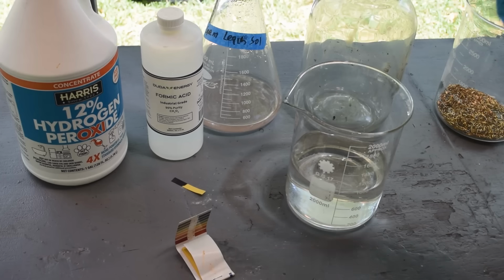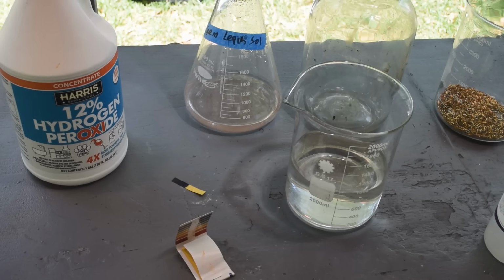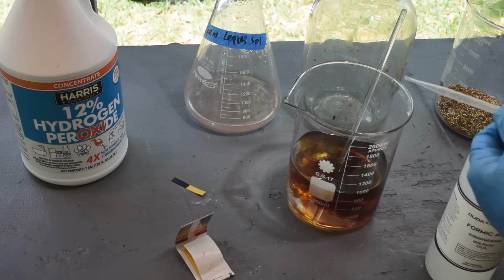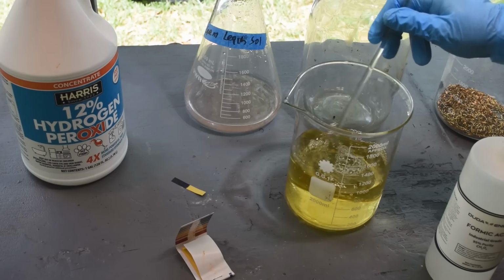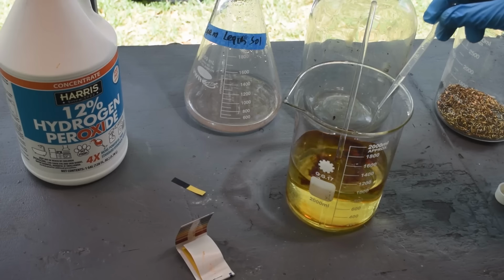To regenerate this, I need to bring the pH down to 7 or below. And probably add some hydrogen peroxide to it if we don't wind up getting free iodine in here just from changing the pH. Let me get a stir stick. And we'll start adding some formic acid to it. I have found that it does not take very much formic acid. Oh, wow, look at that. We're getting free iodine already. That's great. Of course, it's going right back into solution, which tells me we're still too alkaline. So we'll put a little bit more formic acid in.